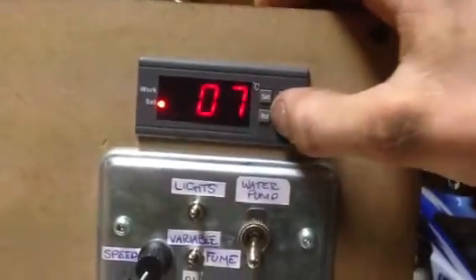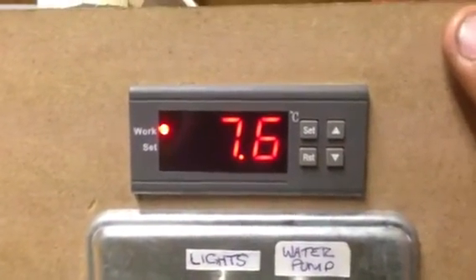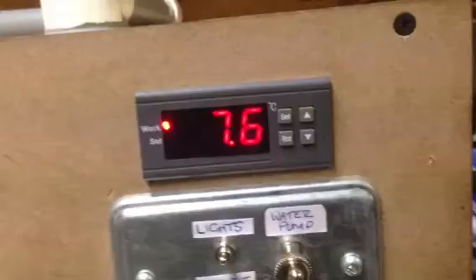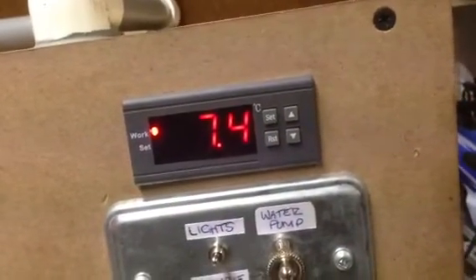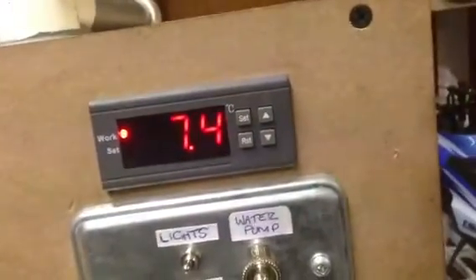The chiller here — set it to say 5 degrees. Before, the lights would flicker when it started up, but that's because the ballast was faulty. Now it doesn't. It still functions perfectly. We got it set here at 3 degrees. It will pull heat a lot better if there's any heat to pull. I plan on running this at usually around 10 degrees for simple stuff, but it is very capable of pulling the temperature down to almost zero. I don't want to freeze the water and crack my reservoir, but it does work really well.